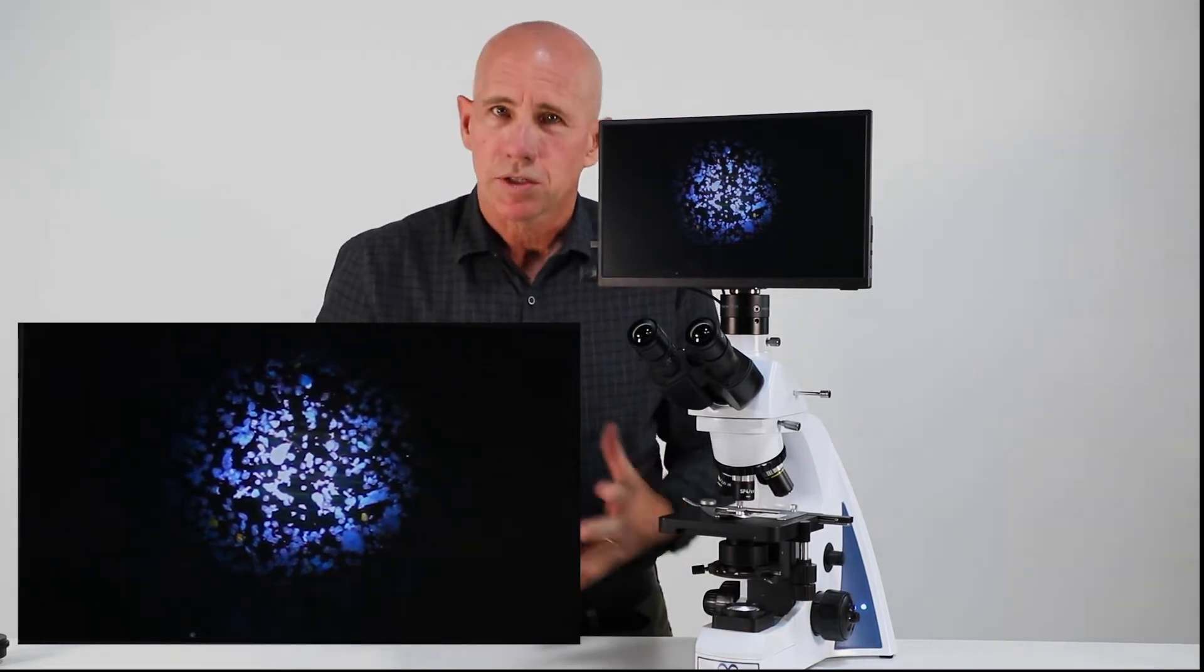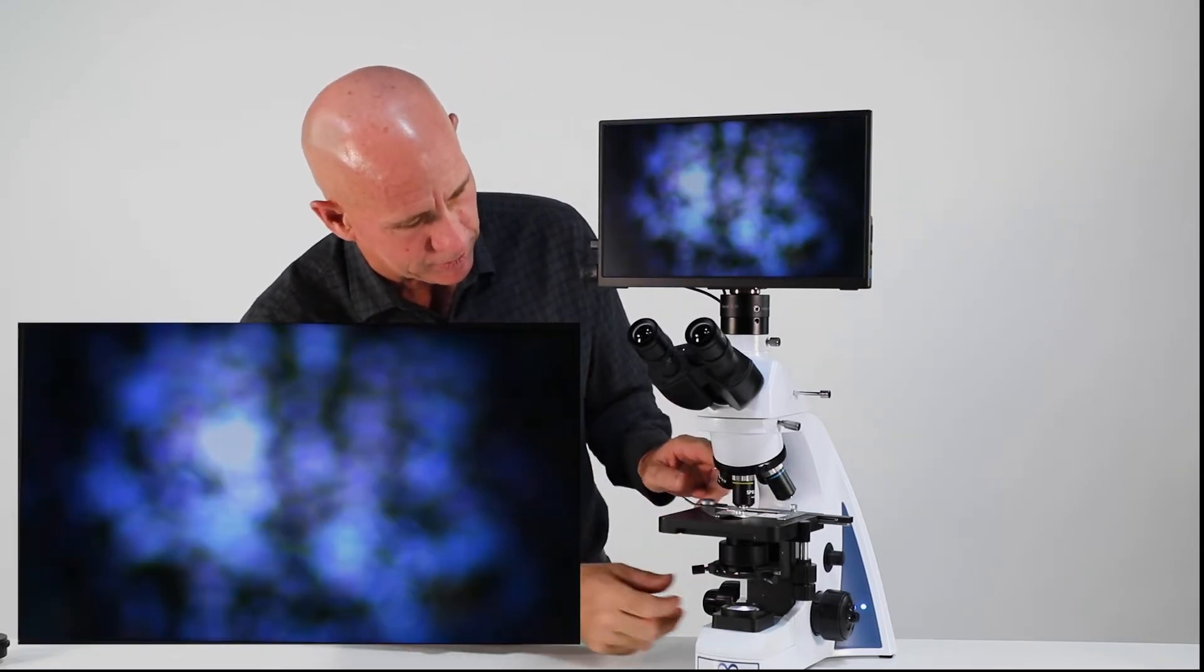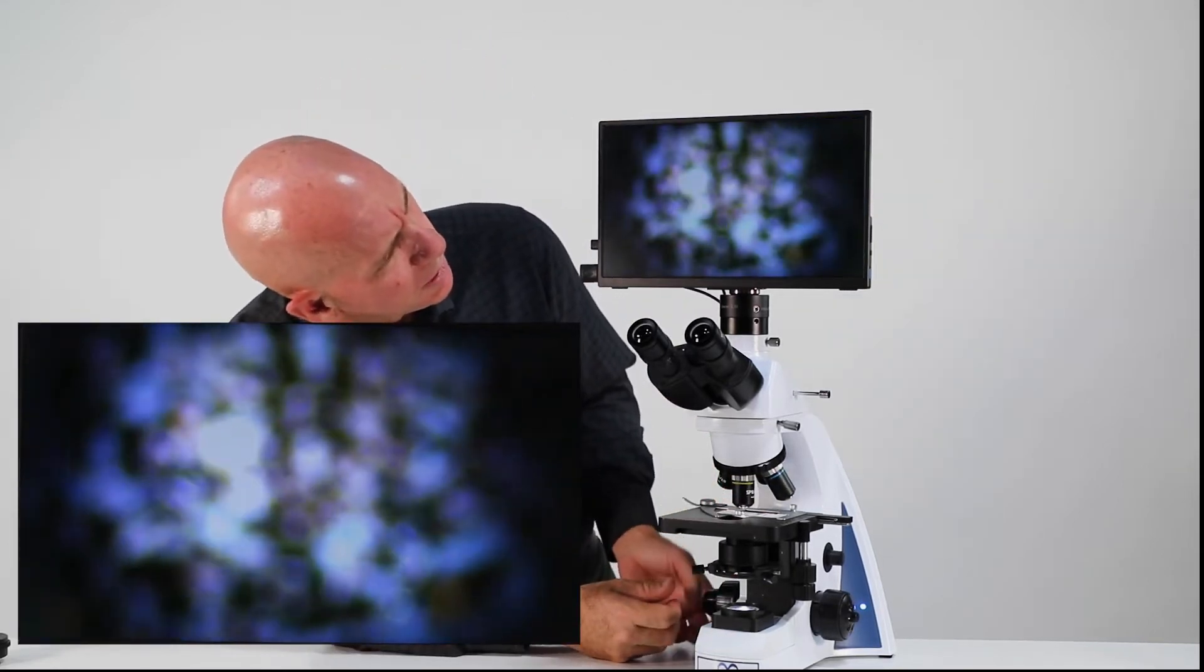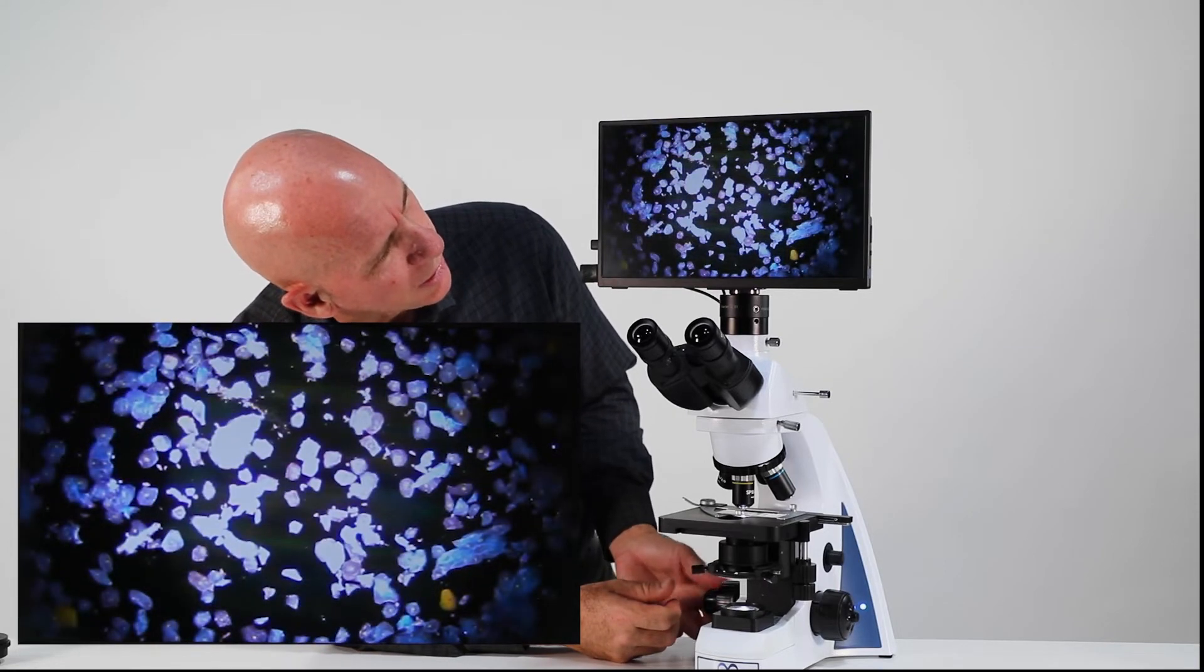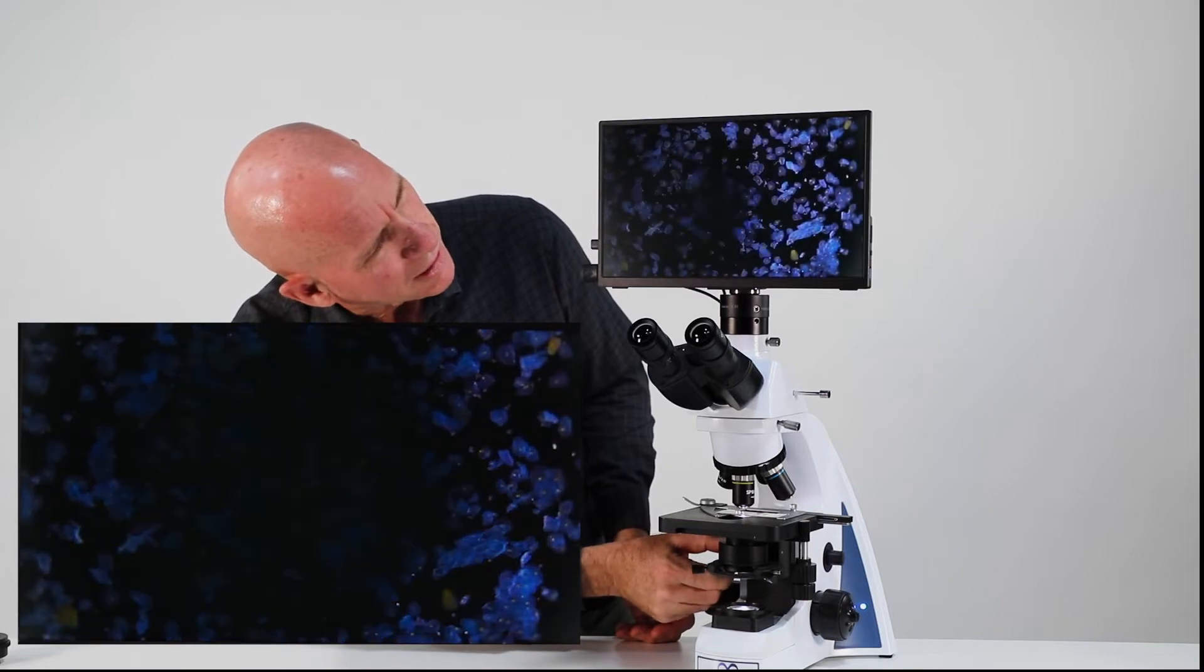Now that's on the 4X. So that's where it's going to be easiest to align it. Then when you go to your 10X, you should be fairly well aligned.